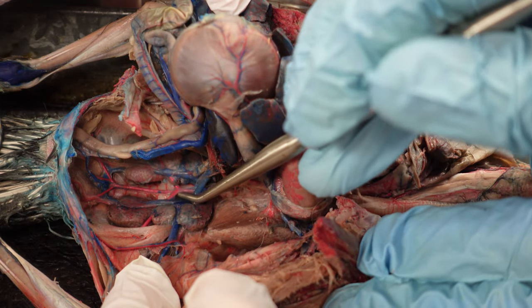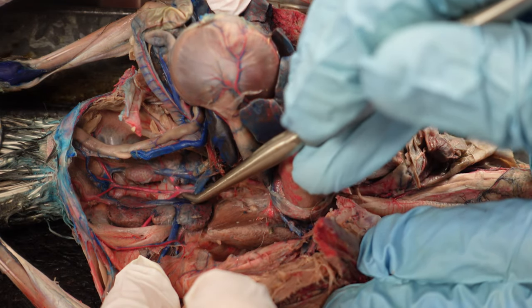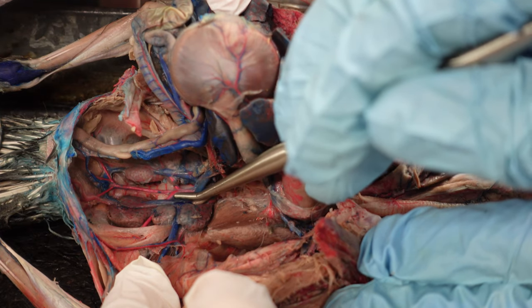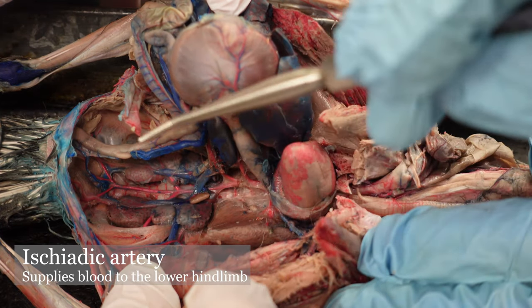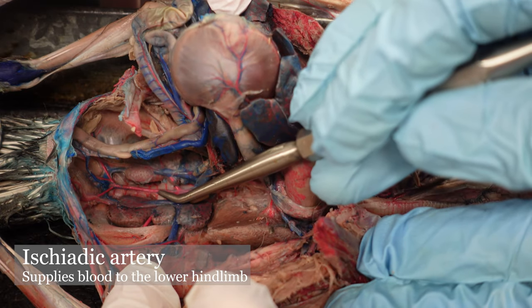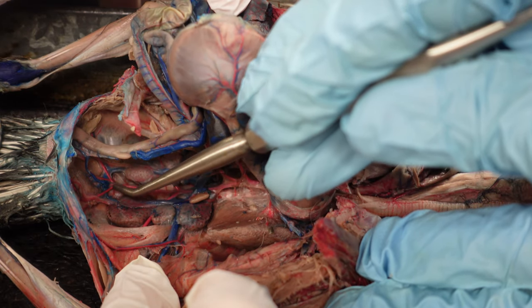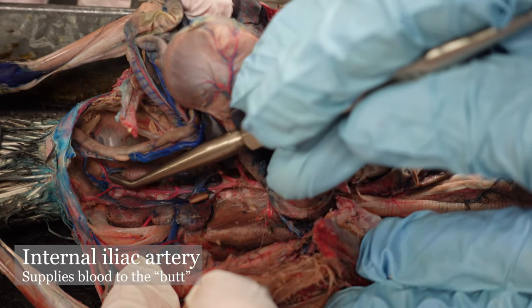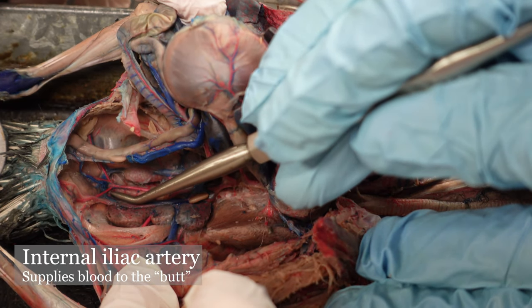The next branch coming off of that dorsal aorta is the ischiatic artery, going toward the ischium. Then we have more dorsal aorta, which then splits into internal iliac arteries.